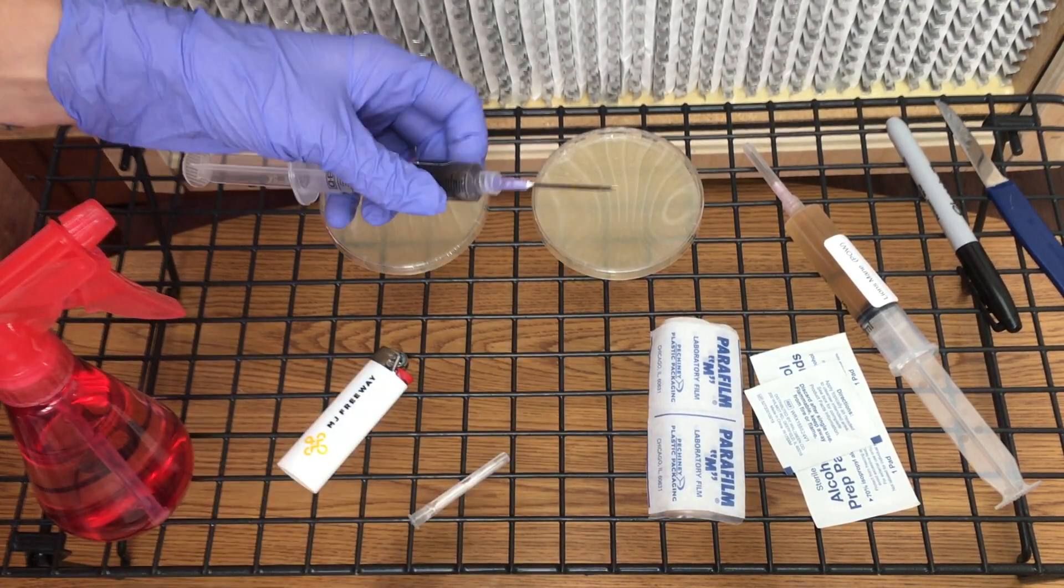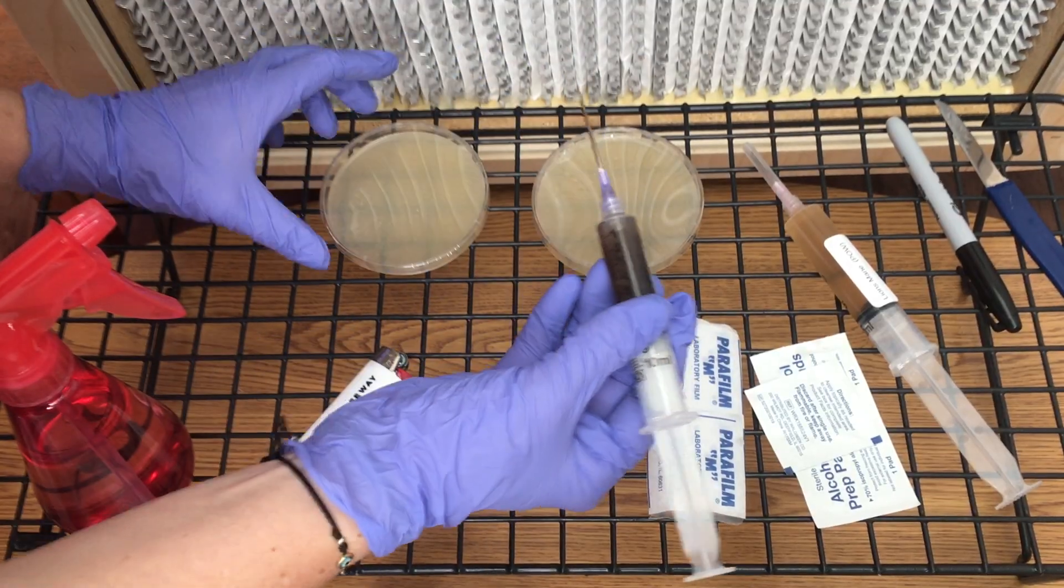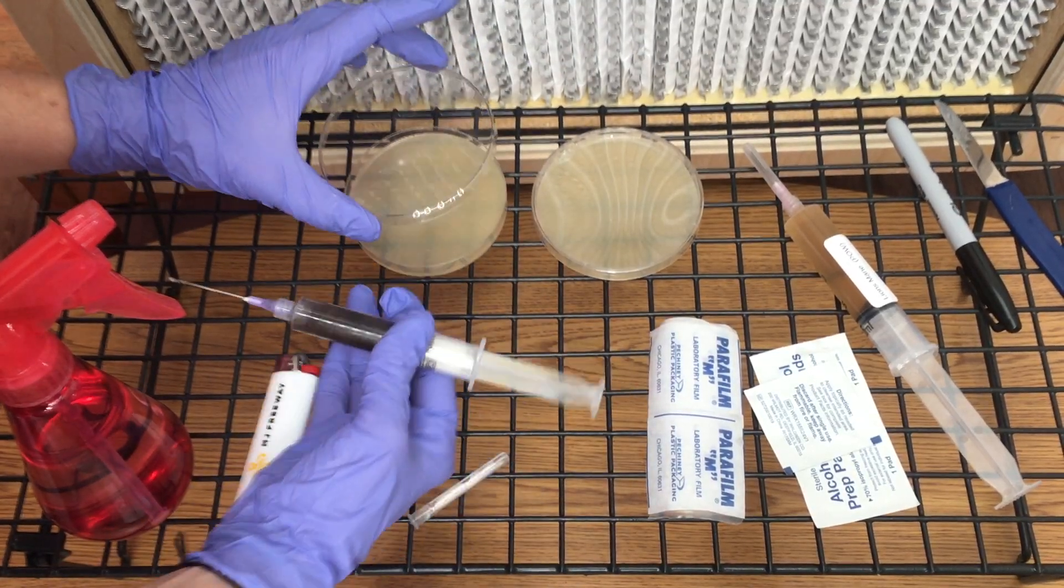After that, squirt a few drops of water out of the syringe, then open the agar tray.